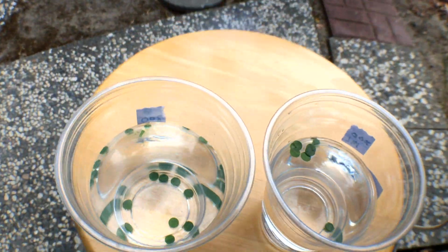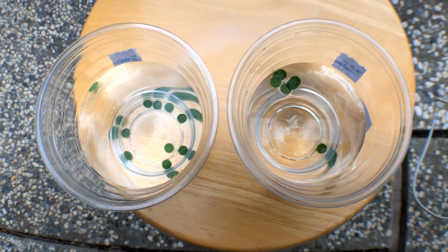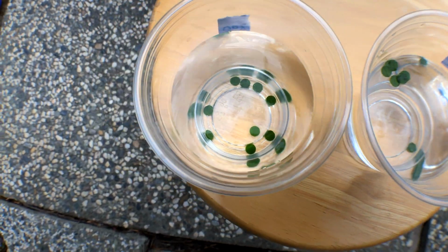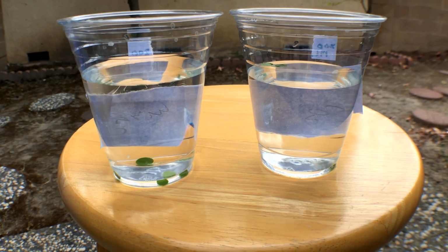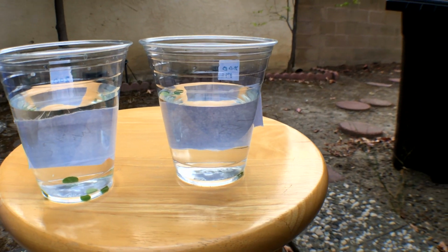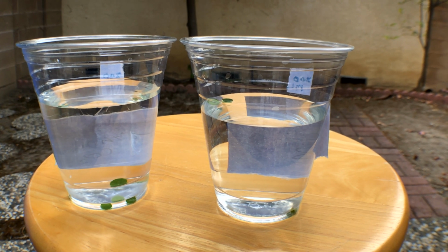Okay, so as you can see, most of the leaf discs in the cup with carbon dioxide from the baking soda have risen. It's that clump over there. And then the ones in the cup without the carbon dioxide, they're still on the bottom. So it's not particularly sunny today outside, but there's still enough light to get the photosynthesis running. And because of this, you can see that the requirements for photosynthesis are met in the cup on the right, because it has light energy, and it also has water, and it also has carbon dioxide.